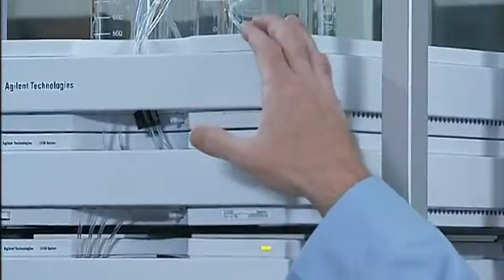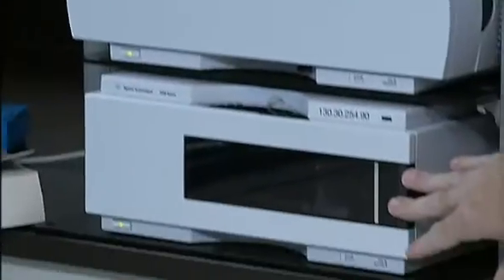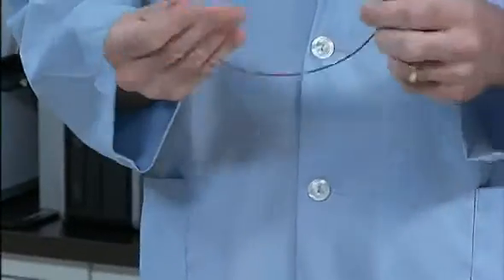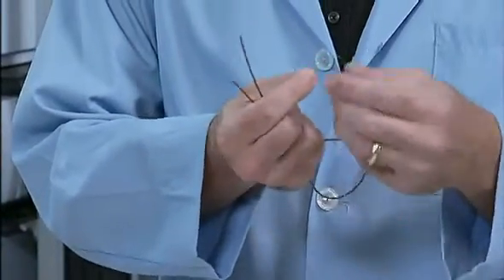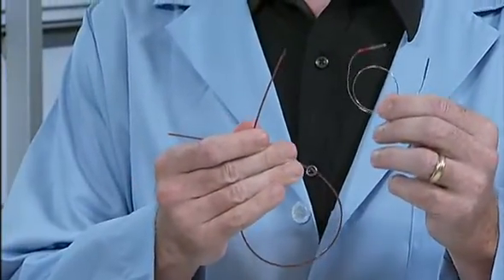Any obstruction in your flow path, all the way from the mobile phase inlet to the mobile phase outlet, can be a restriction. To cut down on extra column band broadening, we often use very small internal diameter tubing in HPLC. So the tubing itself can cause a back pressure. In fact, some very high efficiency columns available now are optimized with very narrow tubing like the 0.12 millimeter ID tubing. There is a system back pressure associated with all this tubing from the pump to the detector, even without a column being present. So there's some contribution to the total system pressure from the hardware.